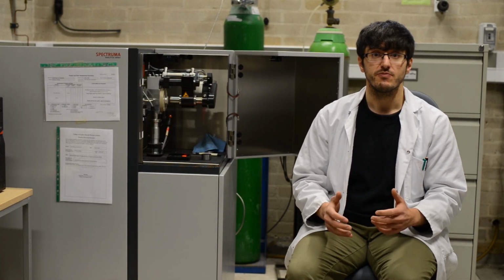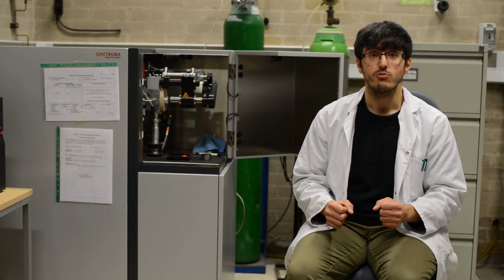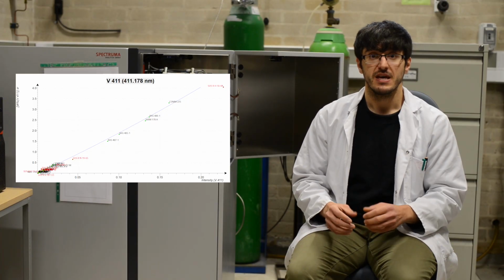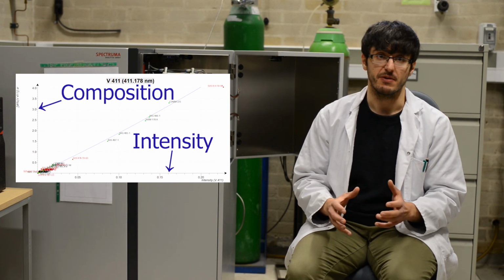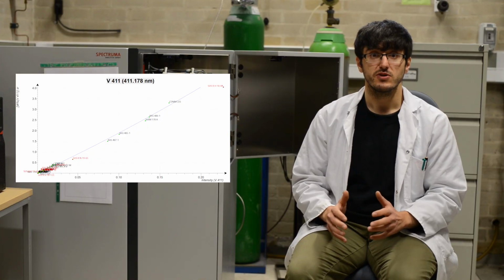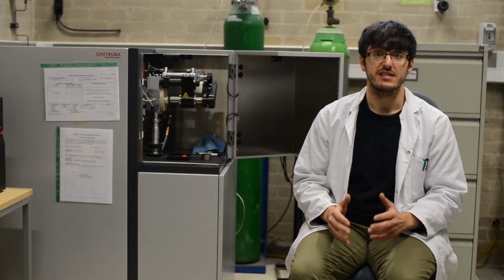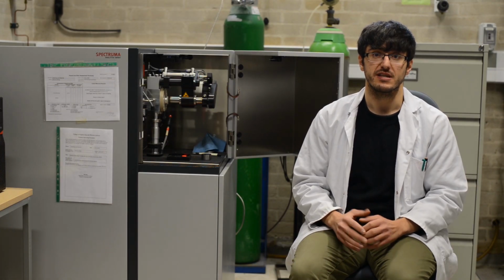Reference or standard materials, which are materials with well-defined, homogeneous and known compositions, help to create databases. Since these materials give reliable and accurate light intensity readings for their composition, it is possible to build calibration curves for the expected light intensity to composition for each element. By using many reference samples with varying compositions, it is possible to build databases for comparison with sample data. If comprehensive calibration curves are set up, then quantitative data can be obtained. However, in most cases, these databases are only semi-quantitative.